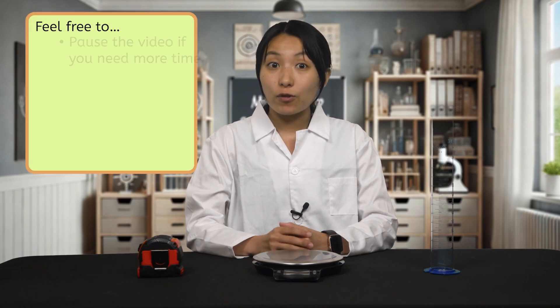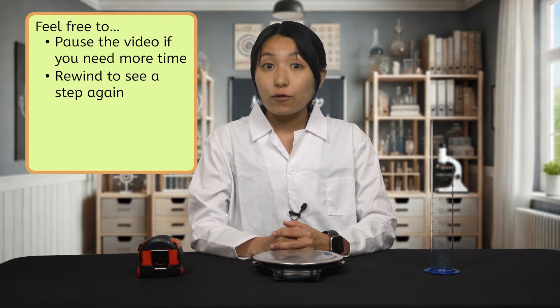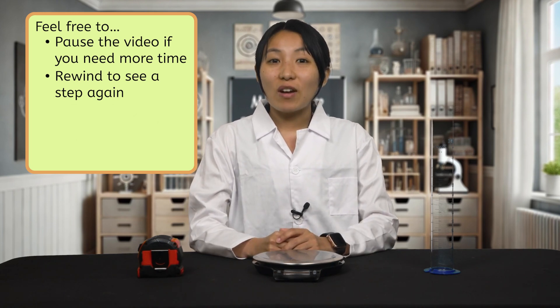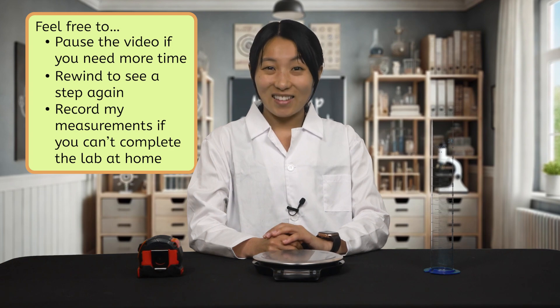As we work through the lab, feel free to pause the video if you need more time or to rewind the video if you need to see one of the steps again. If you can't complete the lab at home, no problem. Watch this video and record the measurements you observe. Are you ready scientists? Let's get started.